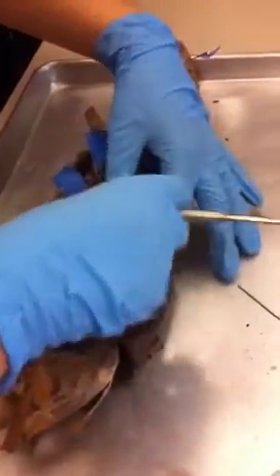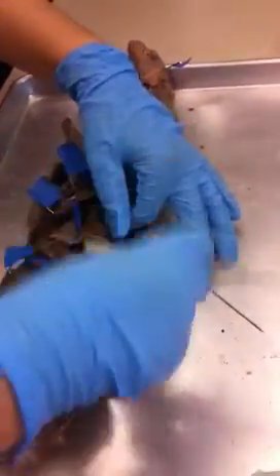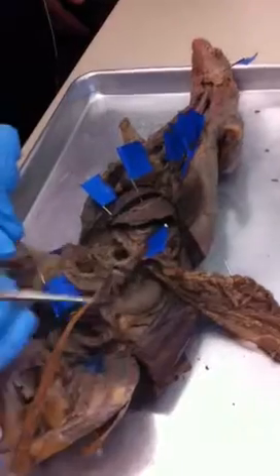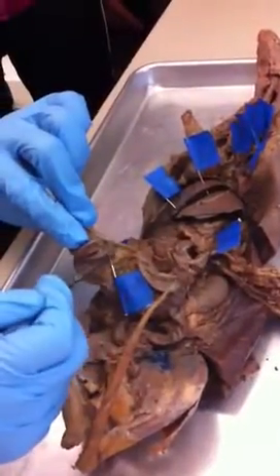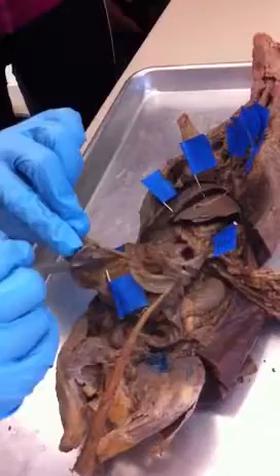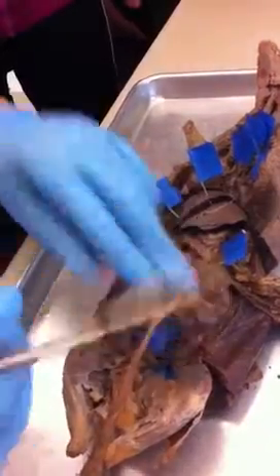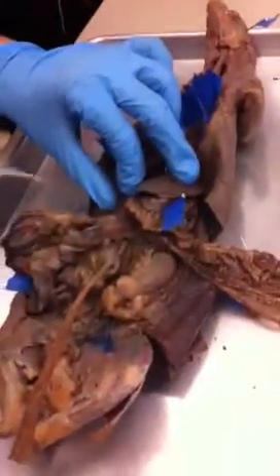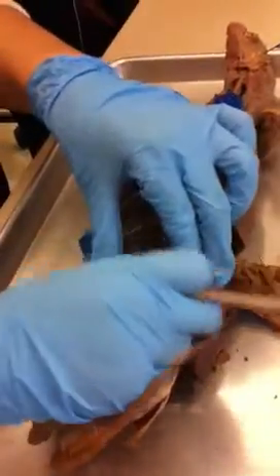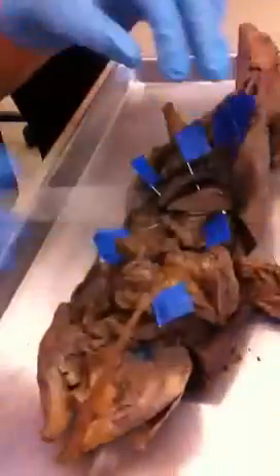This is the stomach, the great omentum — come down, come back. The things on my hand, it's the great omentum. And this is the small intestine. If you hold the small intestine, you can see all those membranes. What are these membranes? The mesentery — all the mesentery attach the small intestine to the posterior wall of the abdominal cavity.